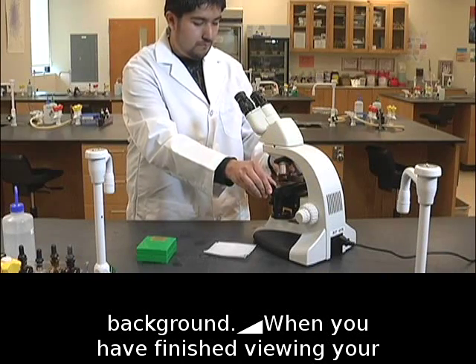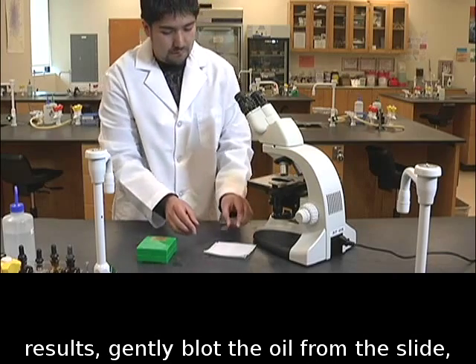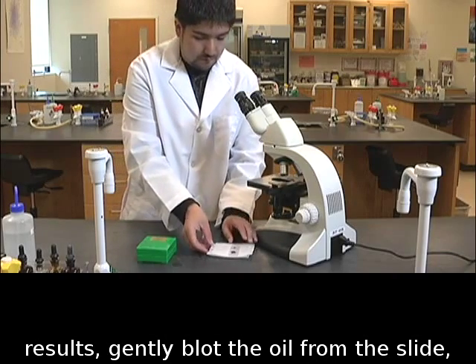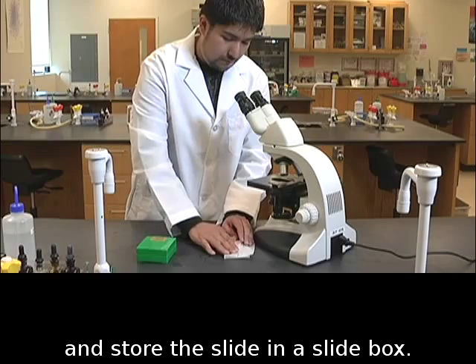When you have finished viewing your results, gently blot the oil from the slide and store the slide in a slide box.